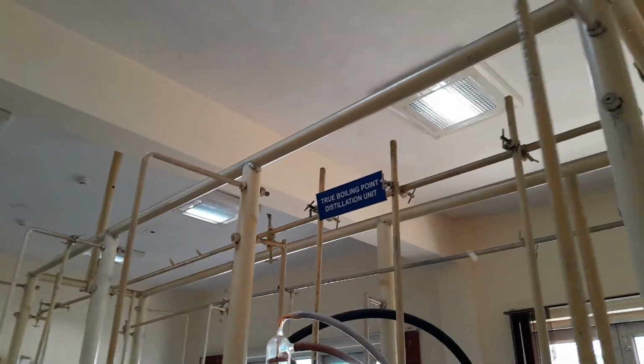Now you know it. What is a TBP? True boiling point.